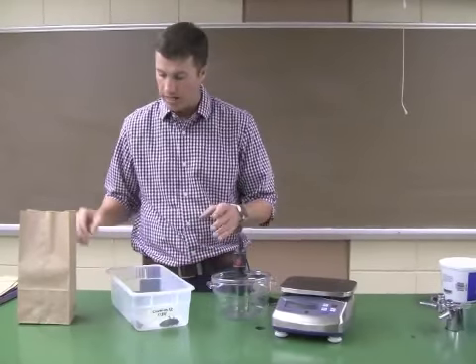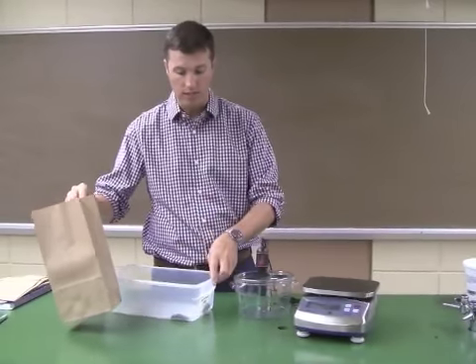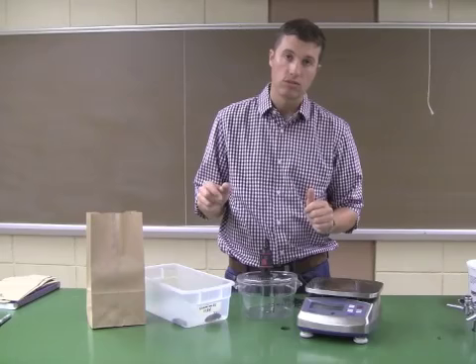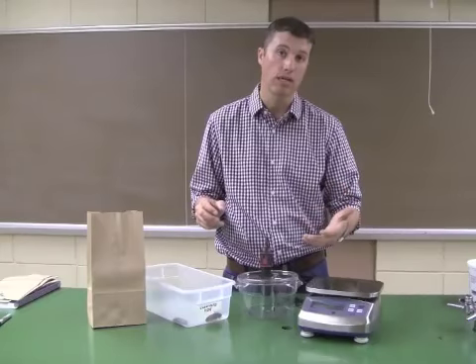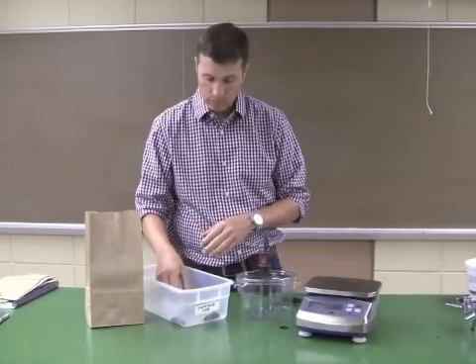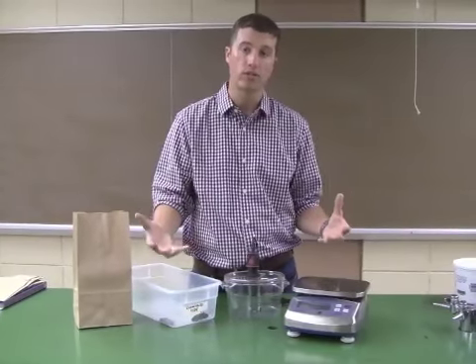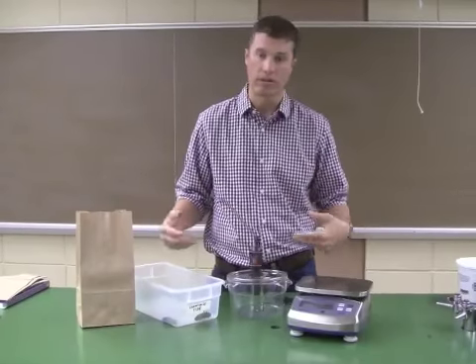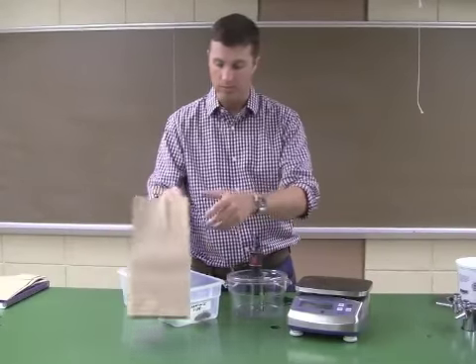And one of the things that you're going to want to do, regardless of which animal you decide to test or which combination, is that you need to weigh your animals to determine how much oxygen they consume or how much CO2 they give off per body mass, per gram of the animal. Because the mice are larger, they have more cells, they're going to give off more CO2 just because they're bigger, not because they're metabolizing faster or slower or anything like that. So we need a way to compensate for that, and the way is to weigh the animal.